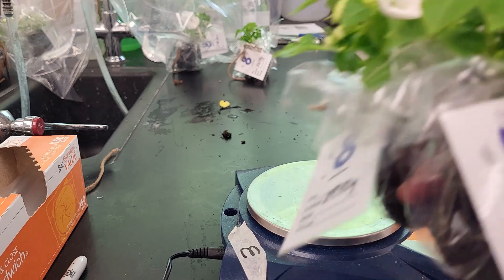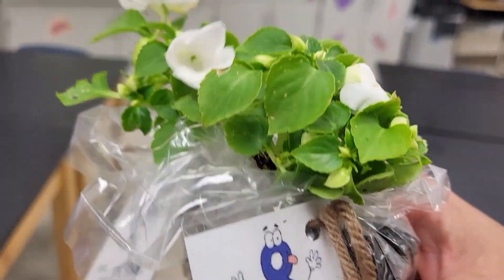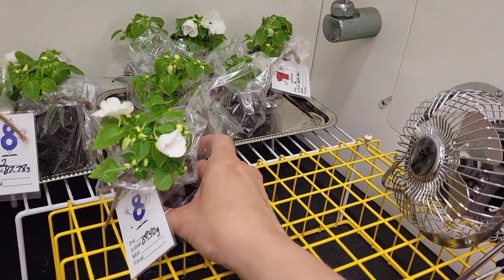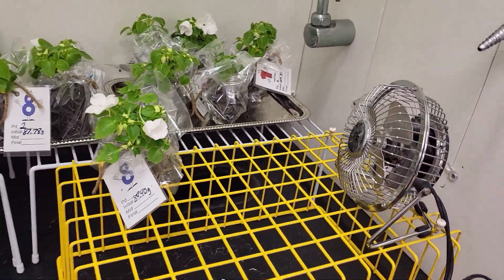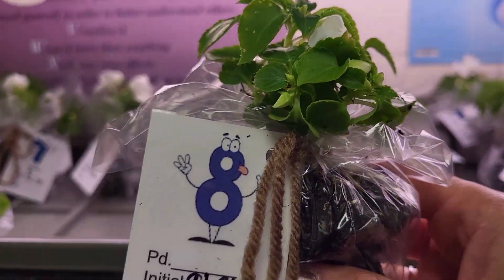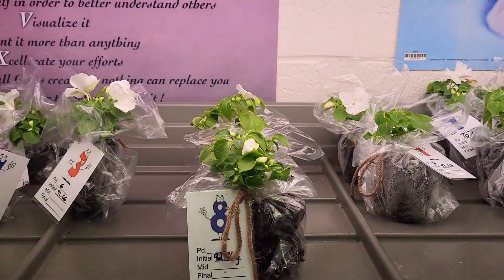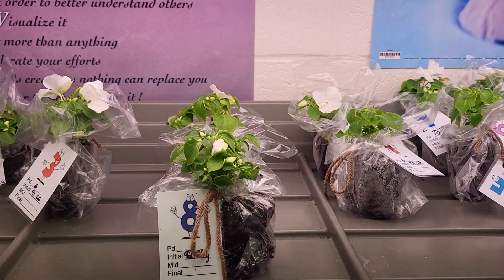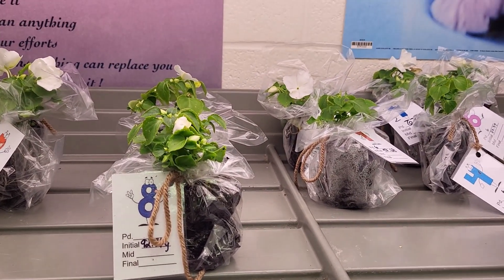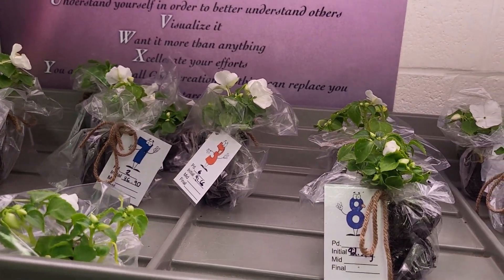We're going to take the plants over to where they need to go. Over here in our fume hood we have a little fan running, so we'll let that plant sit in there. Then we'll carry the last one over to the light cart and place it there. The plants will sit in those conditions until our next session in two days, when we'll record data, and again the class after that for our final measurements. We'll measure change in mass over time and use class data averages to calculate the transpiration rate.